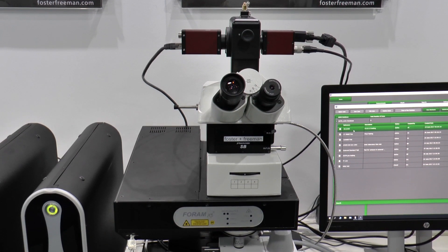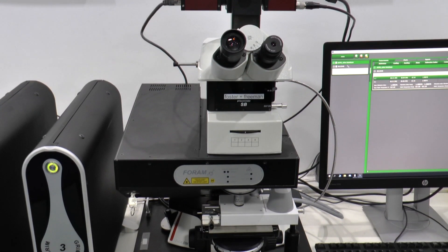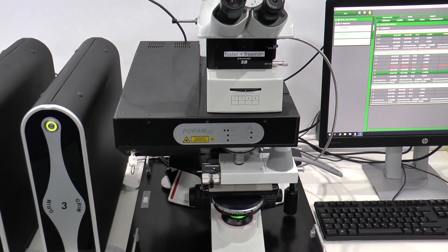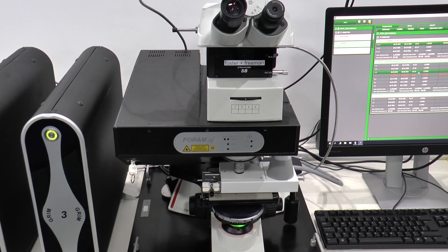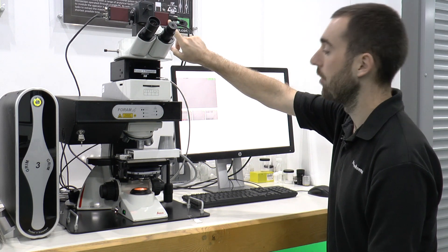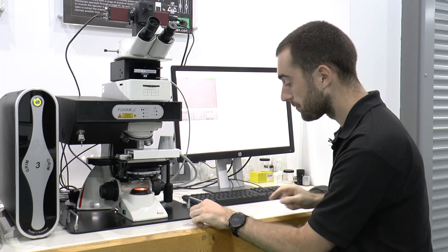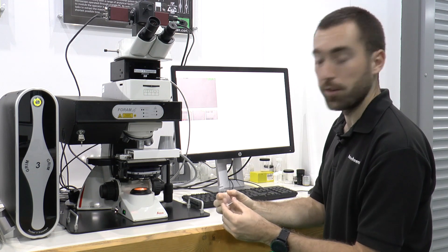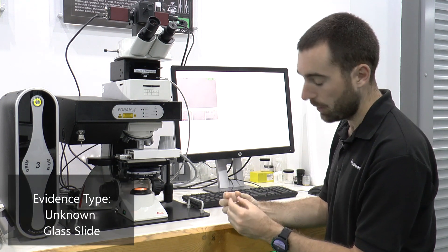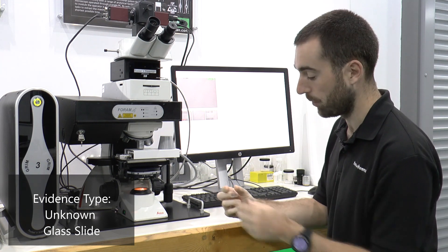Here we have our FFTA microscope system and the first module demonstrated is the GRIM. The system is configured for GRIM use, with the camera on the GRIM and the hot stage in place. A slide has already been prepared with an unknown glass sample, and we wish to measure the refractive index of this particular sample.